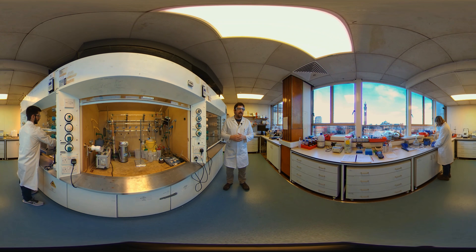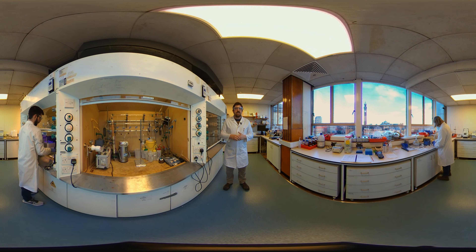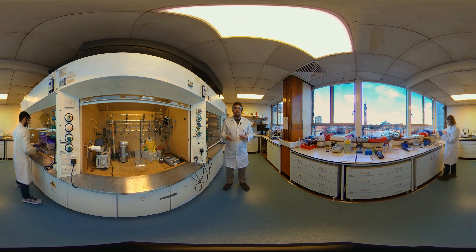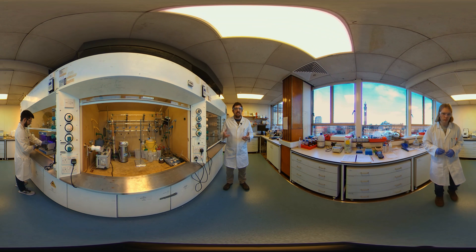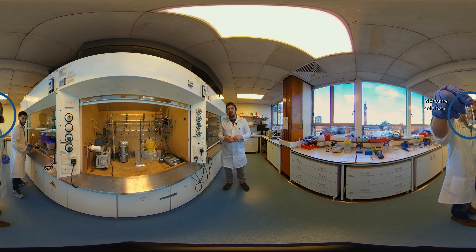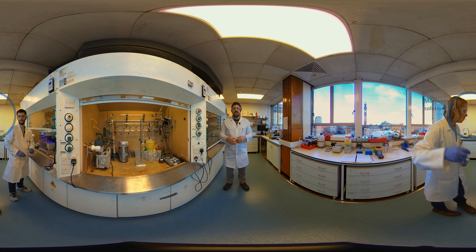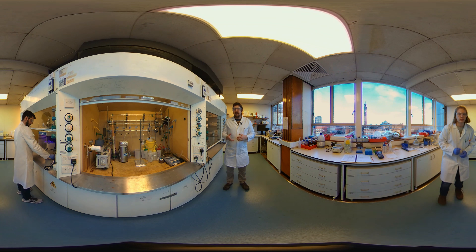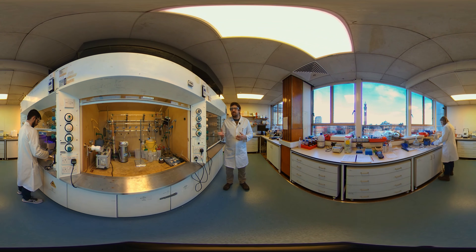So as you'll see over here behind you, Rob is weighing out some of the components of this polymerization-induced self-assembly, such as monomer and initiator, and placing them in water in a vial. You'll notice that before the polymerization, the vial is completely clear.